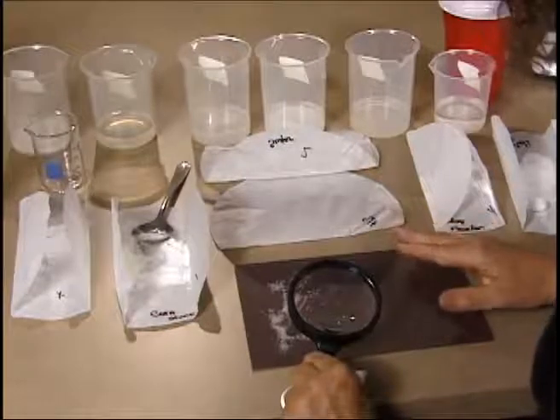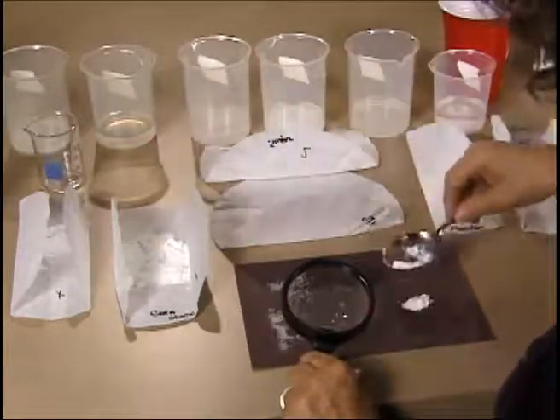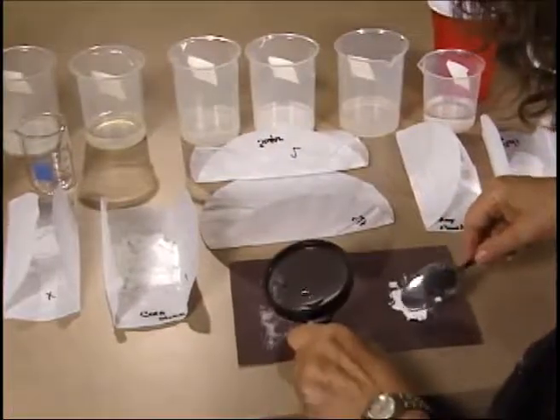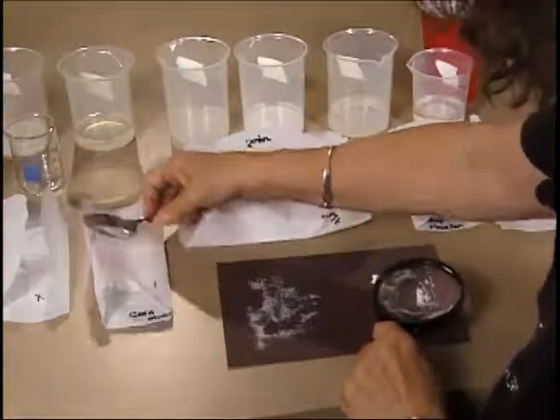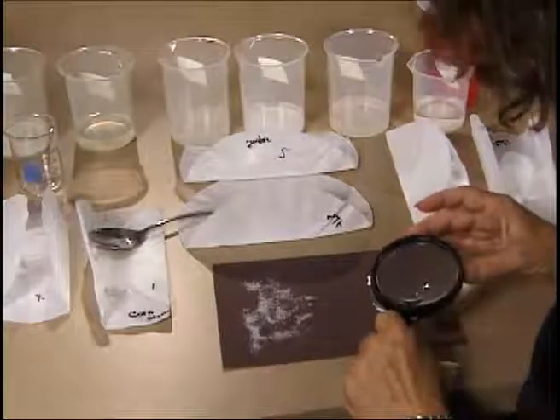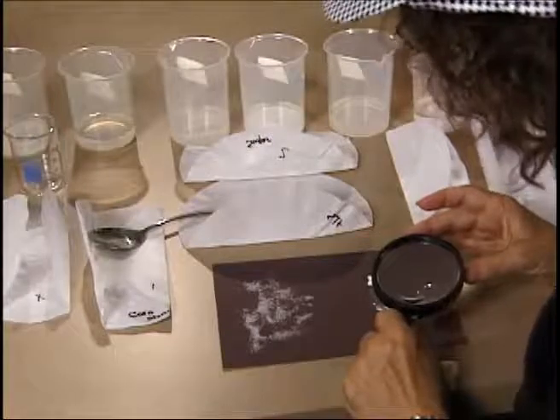They're very distinctive in shape as compared to this particular one, which when I put that out and try and spread it out on a dark background so that I can look at it, it's very definitely much more powdery, and I can't get any distinct crystals. They almost look like they're elongated rods.